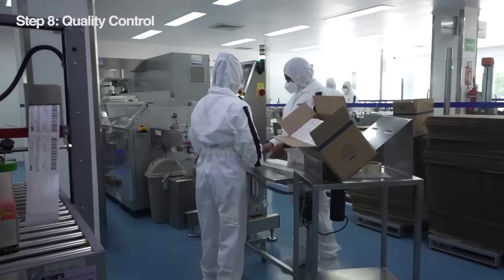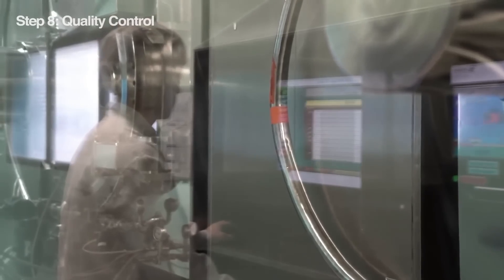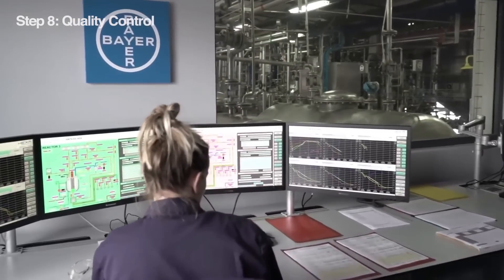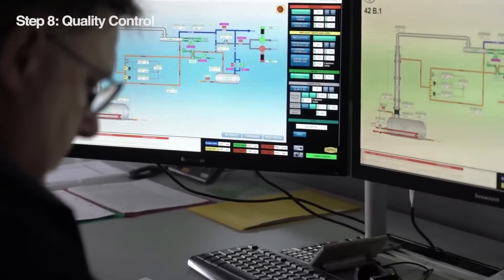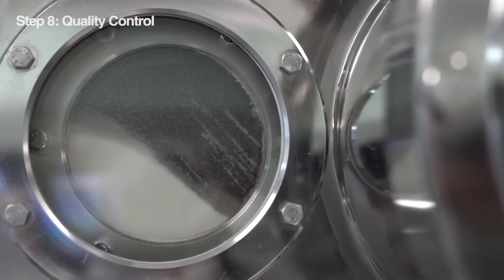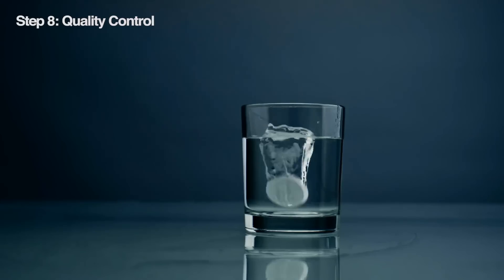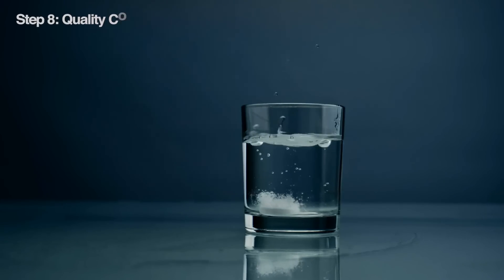Scientists also do random checks on each batch, just to be extra sure every single one has the correct dose. They compare the results to super strict standards, and if anything falls outside those lines, they investigate further. They also keep detailed records of everything. In the end, all this hard work ensures that every single aspirin dose is potent, pure, and exact — so you can be confident that the aspirin you take is safe and effective for pain relief.